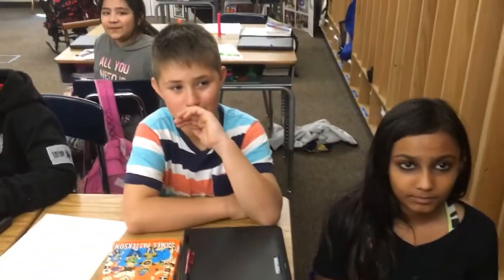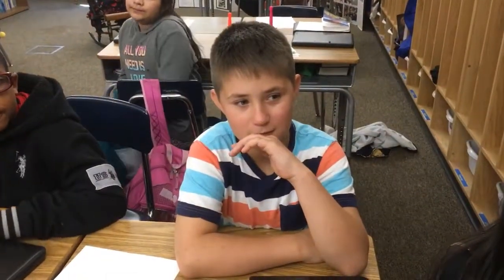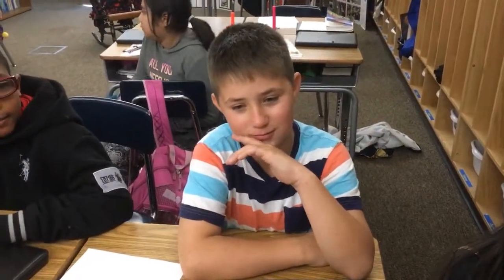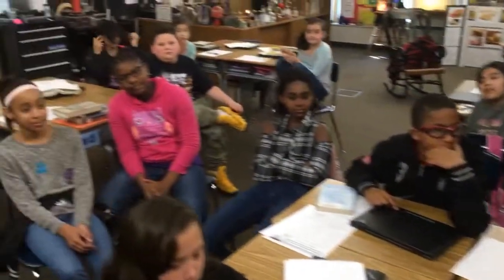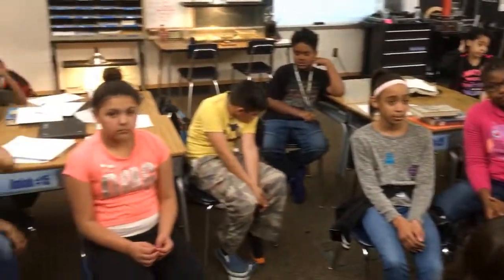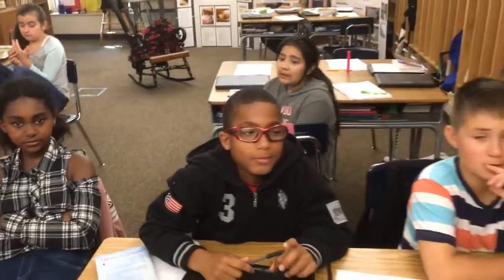Chase, this first flask here with the water in it, most of our planet is covered with water that we call the ocean. It's the ocean, yes. And so the sun shines down on the ocean and it starts to evaporate. And evaporation, we know, is the first step of the water cycle. And as water evaporates, it has to go somewhere. Where does the water go? Clouds. It goes up into the clouds, and we call that condensation.